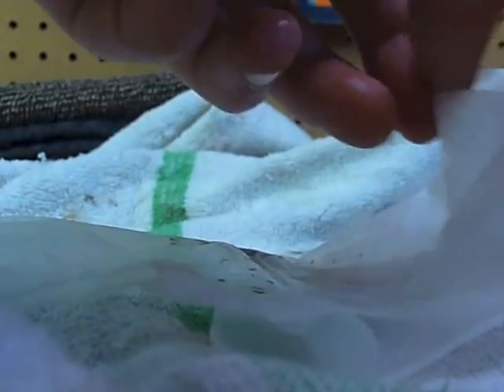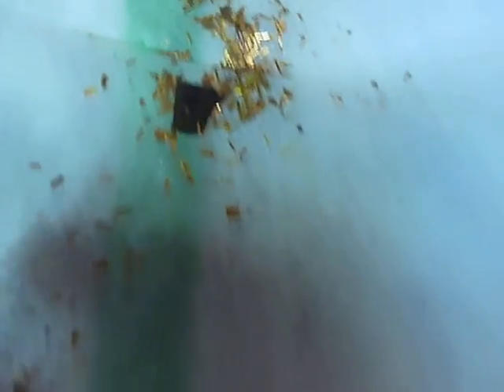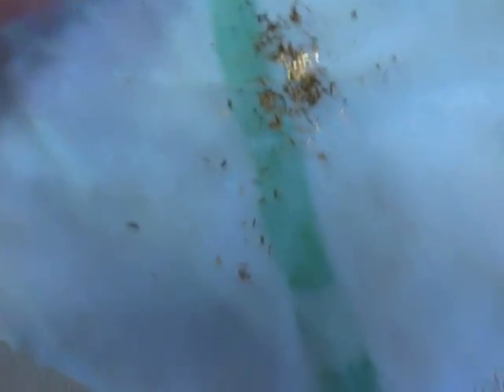Here's the first filter I went through. I'm going to spread it out on this towel to dry out. What I did to get all of the gold powder at the bottom is I rinsed around the edges with water so that it all flowed down to the middle. And that's what you're left with. You can see there's a couple green pieces of the PCB board there, but that's all gold besides this speck of black, which is also part of the PCB. I've never had a chunk come off that big. But this stuff sticks to everything, so I'll just wipe it off. And that's the gold — I'm going to let it sit out and dry, and then we can just brush it off.